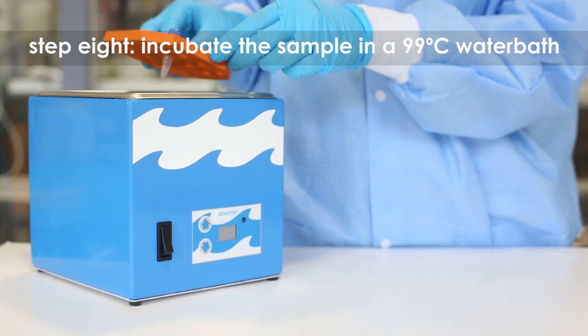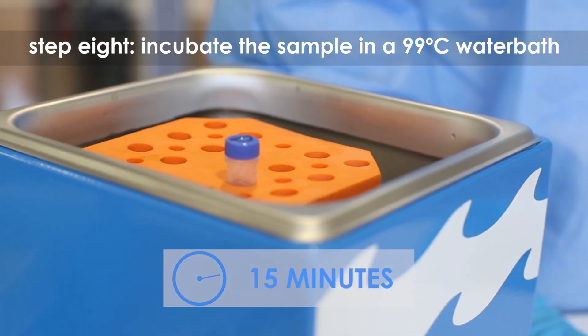Step 8: Incubate the sample in a 99 degrees celsius water bath for 15 minutes.